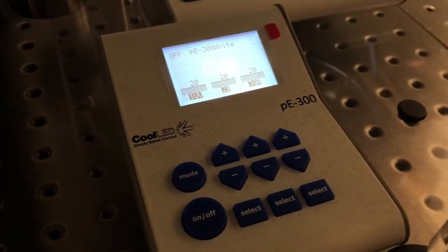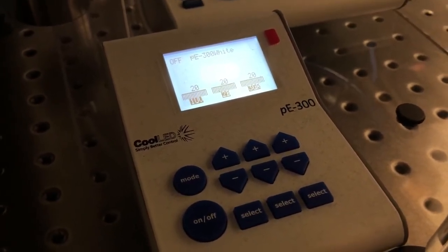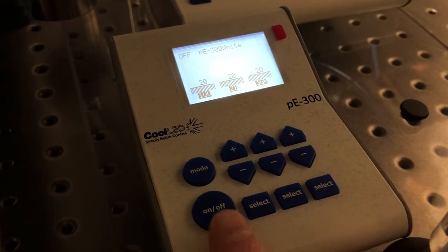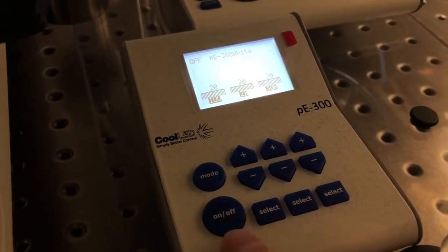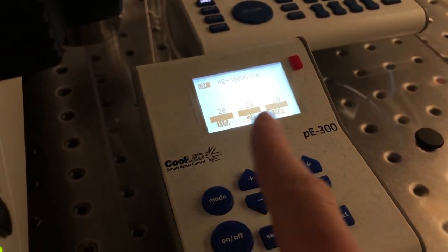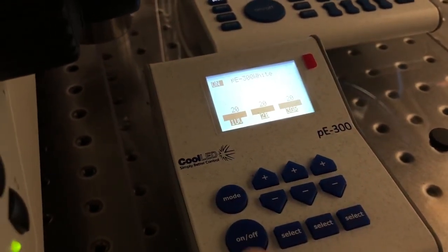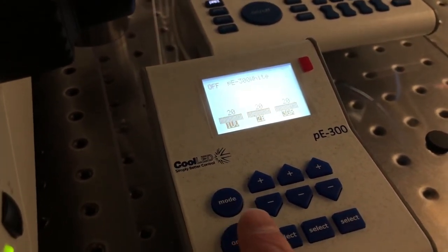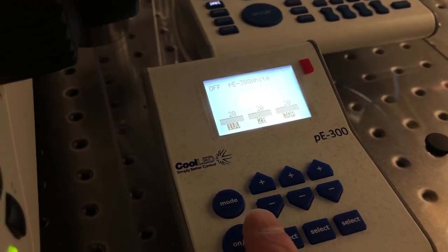There's one more thing we need to do if you want to look at fluorescence by eye, which is on this control panel we need to turn the light on and off using this button. If you press it, it goes to on, you can see those turn dark. If we're on the off position, those have this hatched pattern.